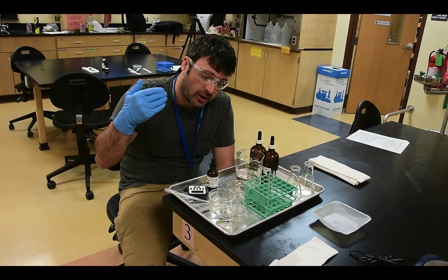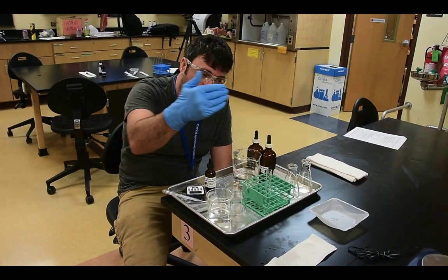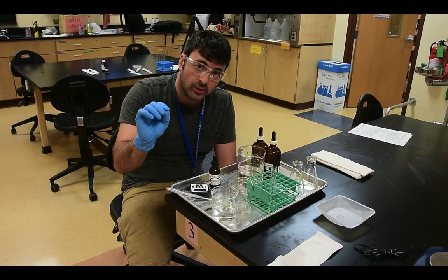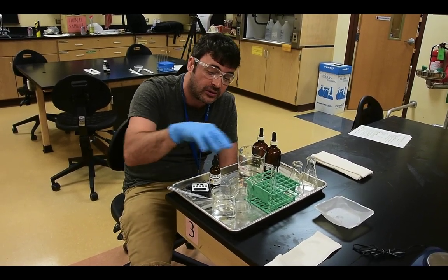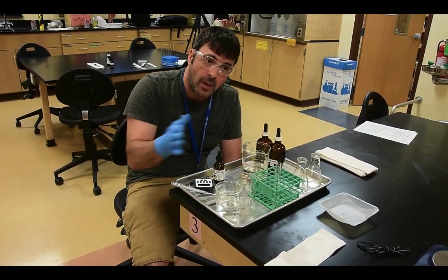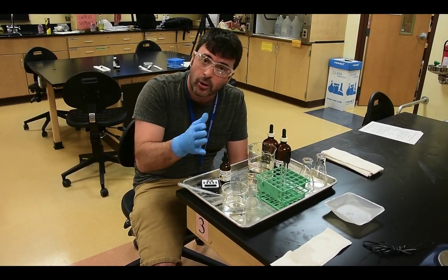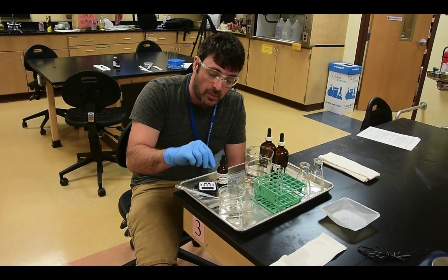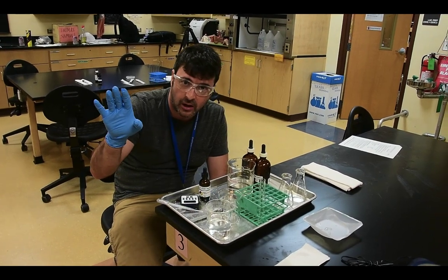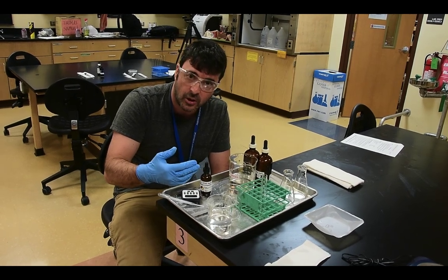Now, based on the initial weight of the cell and the post-solution soak weight of the cell, you can start answering questions in your lab. The final set of questions in your labs relates to this experiment that we're performing now. So we want to determine whether the dialysis tubing membrane is permeable to sodium chloride. Now remember, this initial solution that we soaked the cell in was distilled water, meaning no sodium chloride there initially. Now we want to determine whether sodium chloride is present or absent.